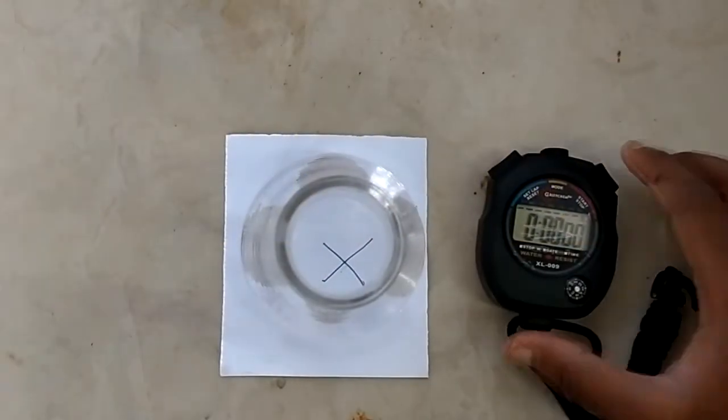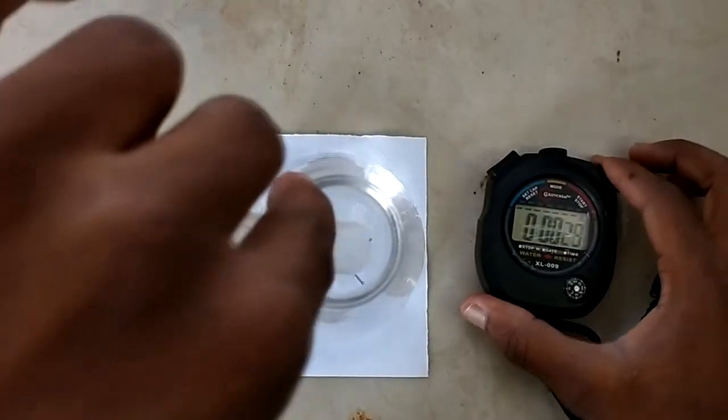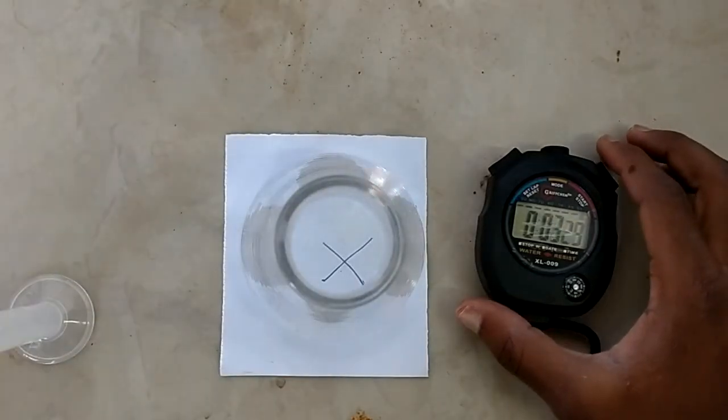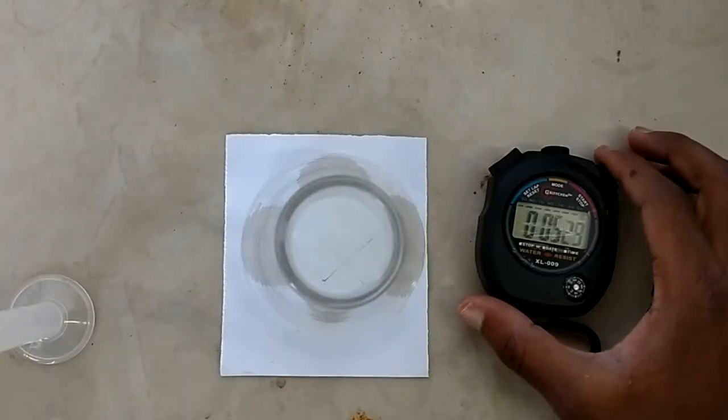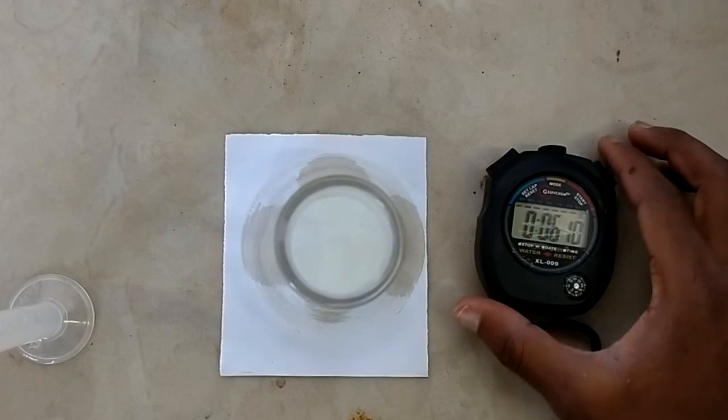And now at 60 degrees Celsius. There you go, six seconds.